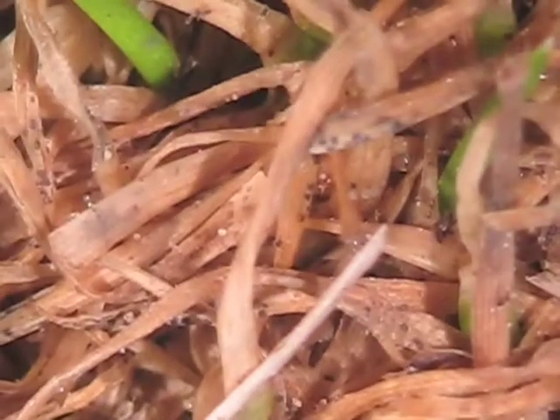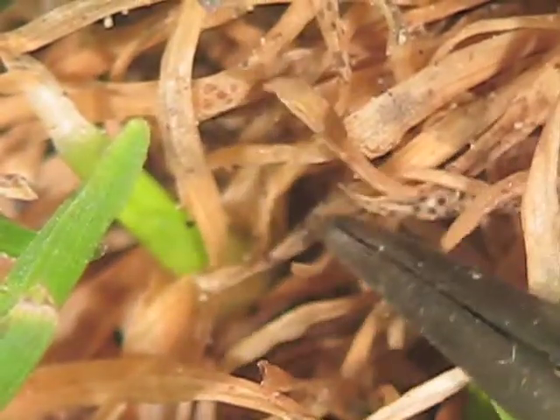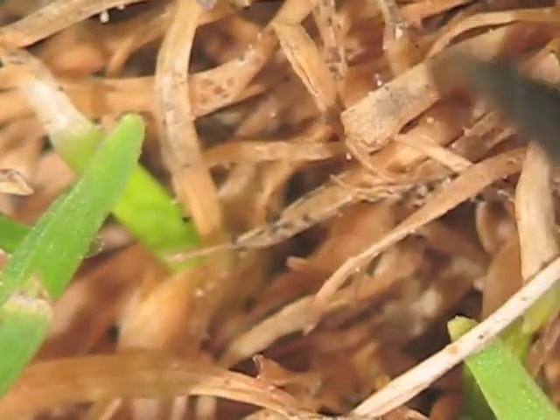Now as we look back at the leaf tissue, what we see when you're scanning around a sample like this one is that the healthy leaves seem to be fine. You don't see a healthy plant that has a lot of damage on it. The plants that are here, you see these dark perithecia, what they're called, of this fungus. We'll talk about what it is in a minute.